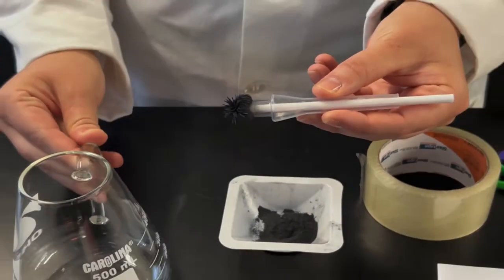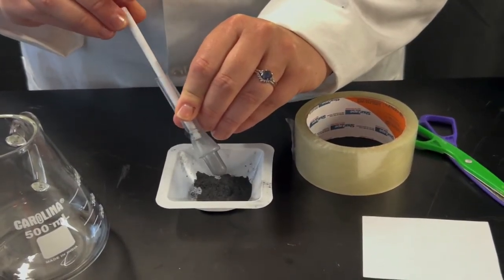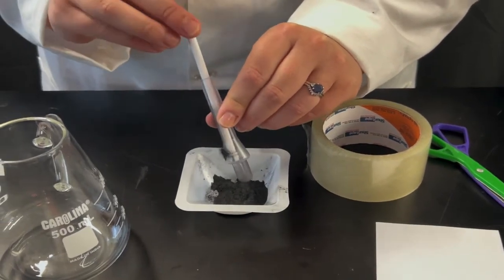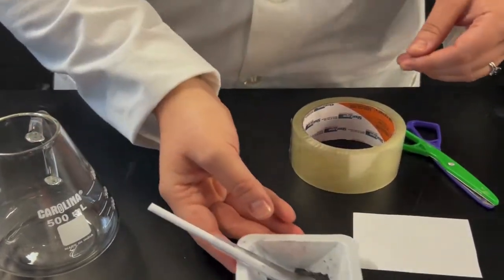Once dusting fingerprints is complete, return the applicator to the source of the powder and disconnect the magnetic connector to release the powder back to its source for later use. The developed latent prints can now be photographed or lifted for analysis.